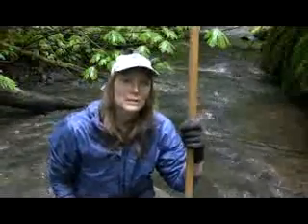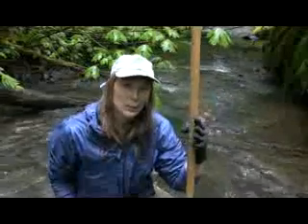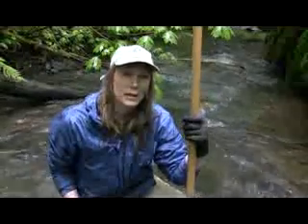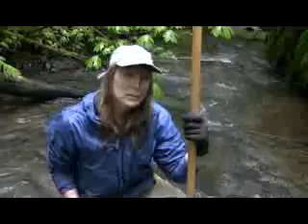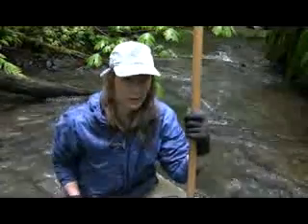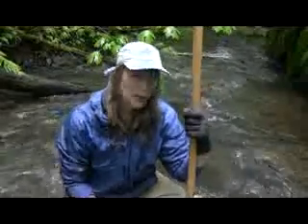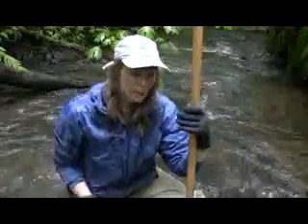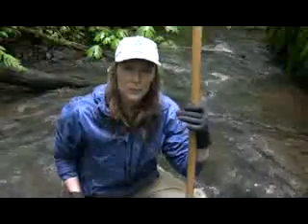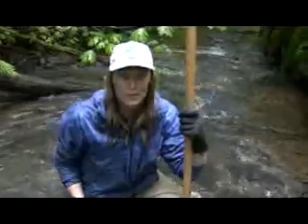In the interest of equal sampling effort, we collect 8 square feet of surface area at each reach that we visit. What this means is that at each of the 8 randomly selected transects, we collect insects from 1 square foot of surface area across the stream bottom directly in front of our net. Now some people like to use frames. They attach a frame to the bottom of the net and that'll help guide their sampling area. Sometimes that gets a little difficult if your bottom surface is really uneven or if you're in like a really cobbly or bouldery sample site.